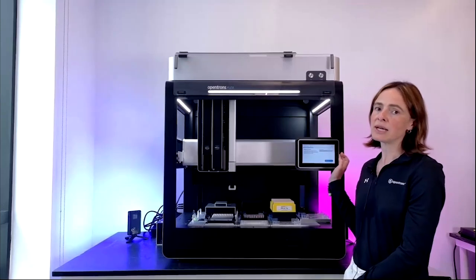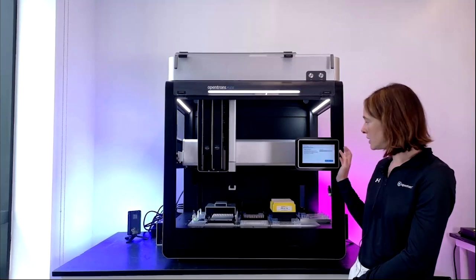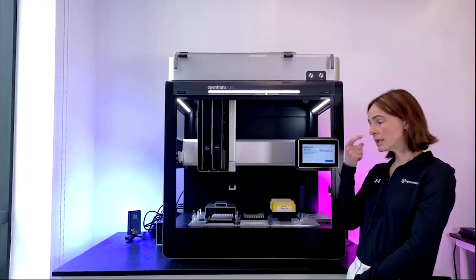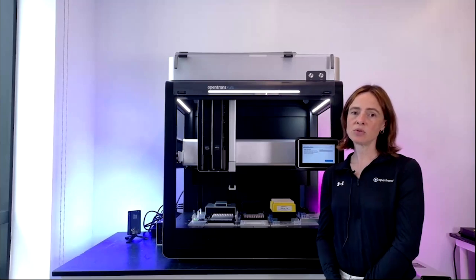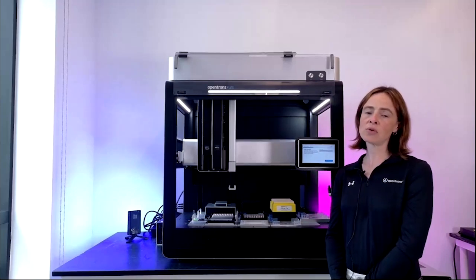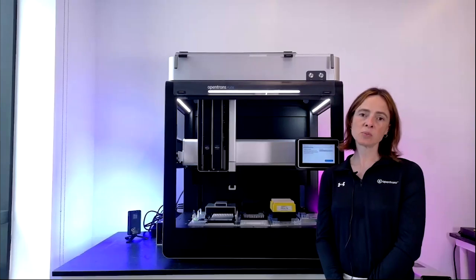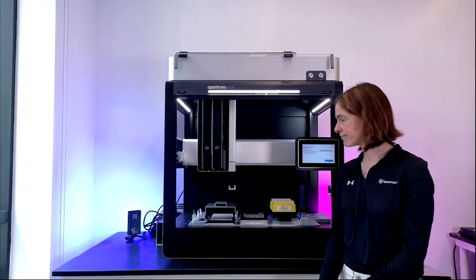touchscreen, which allows you to easily store and pull up and then run protocols. It also guides you through deck setup, and Nick will talk you through that in a minute, and an automated calibration. And most importantly, it's really here to provide you with a lot of prompts and guidance. So it really makes the steps that you go through before the robot starts to run really straightforward and easy to follow. And that should be for anyone in the lab to carry out experiments on this robot, whether they're really experienced with automation and Opentrons products or not experienced with automation at all.